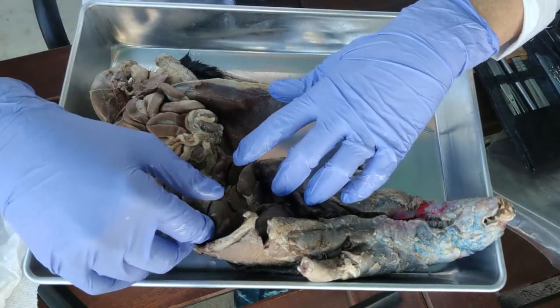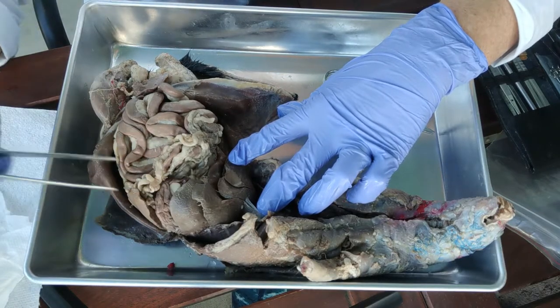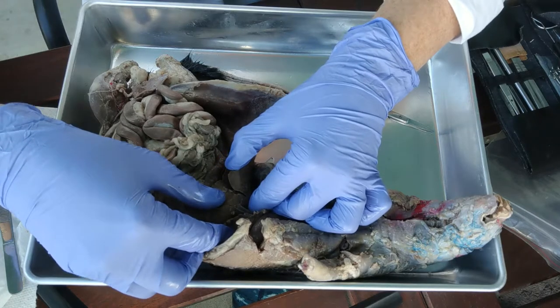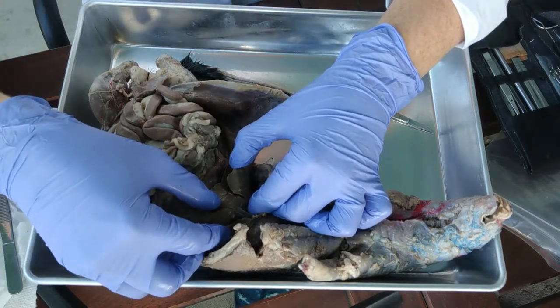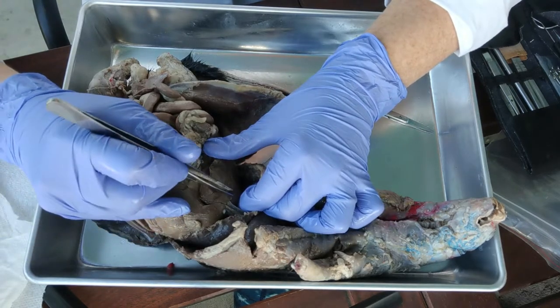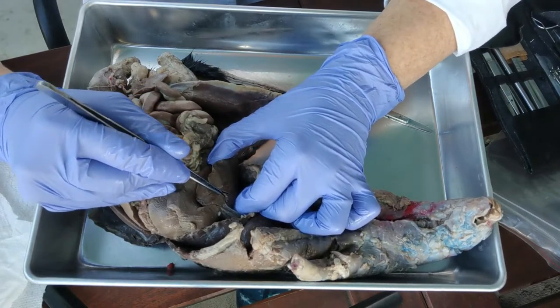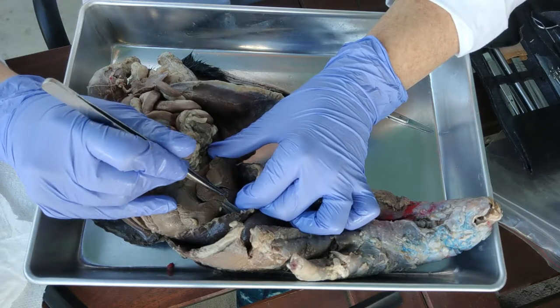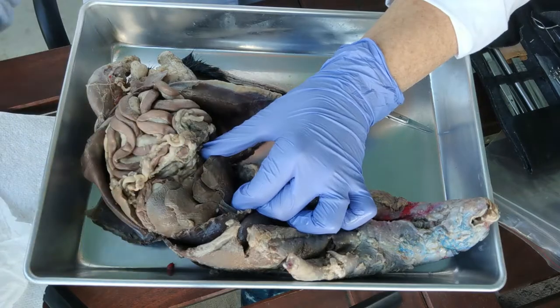Notice that there are several lobes of the liver. Next we want to find the gallbladder. The liver is what produces bile, but the gallbladder is the structure that stores the bile when there's extra. In the very anterior part of the liver, gently pull apart the lobes and look for a little pouch. Right here we have that pouch — that's the gallbladder, sandwiched between these two lobes. Often the gallbladder will be green because bile is greenish, which can help identify it.